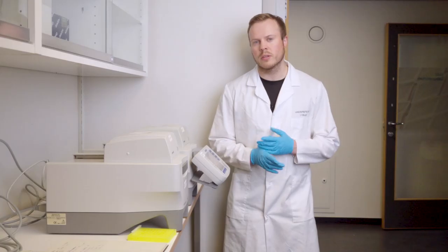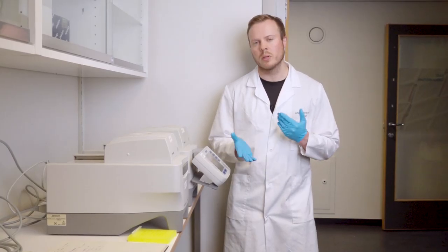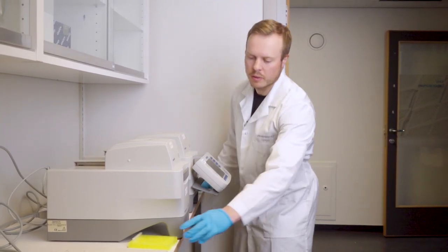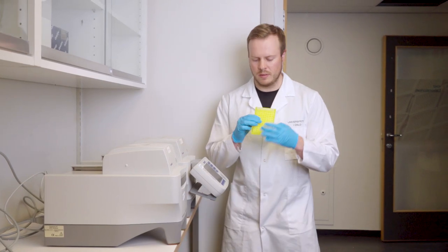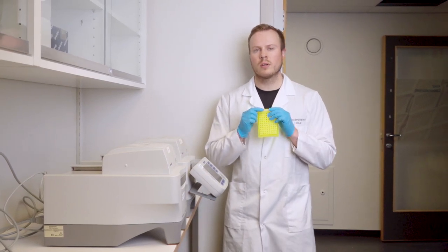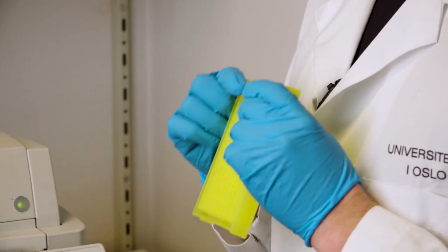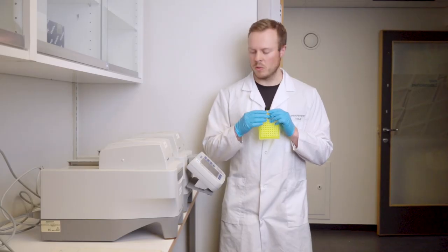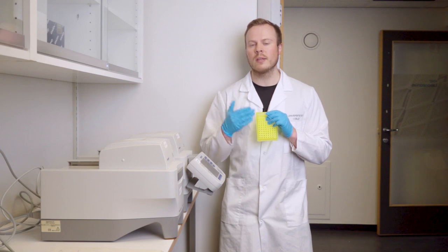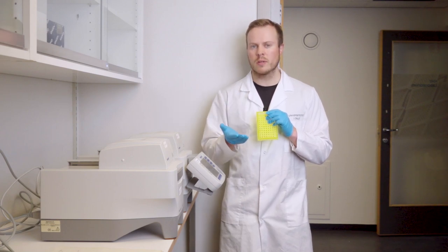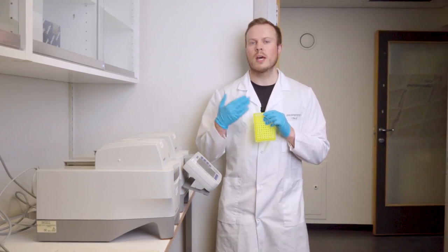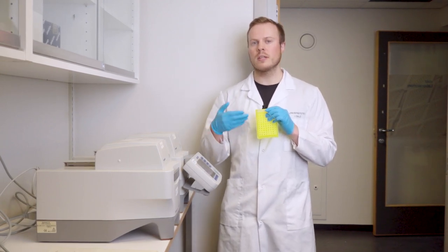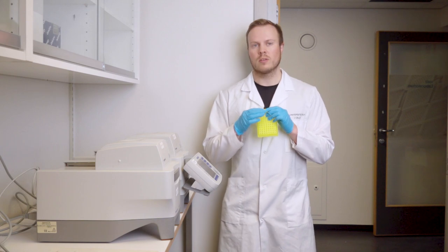There are some slight differences between PCR1 and PCR2. The biggest difference is that right now in the prepared PCR tubes we have a higher concentration of DNA because we have already run one PCR. Therefore, we don't need as many cycles. The cycles we are running now are just to attach the index primers and increase the amount of them in the tubes.